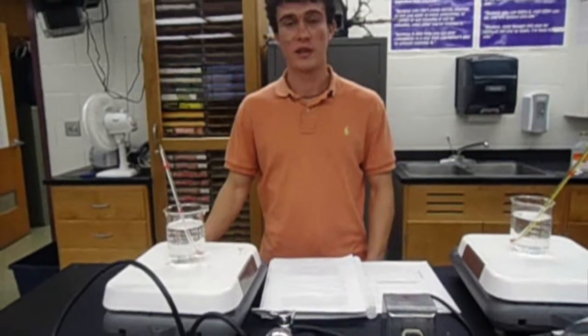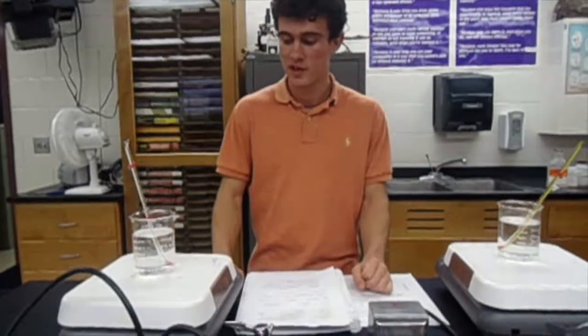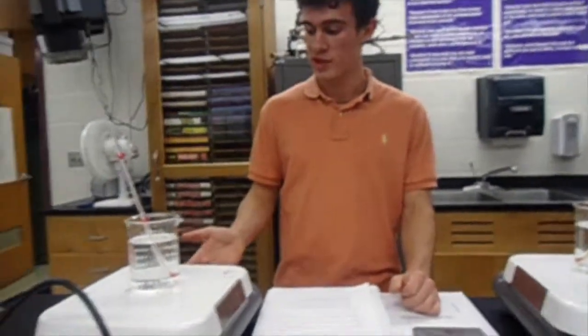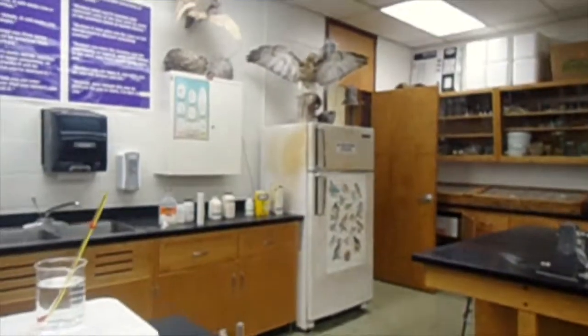I'm here doing a lab for my AP Biology class, and our discussion in class has been on cellular respiration. So we had to make up our own lab, which was pretty interesting actually, about cellular respiration and efficiency. We chose to do temperature, so we have ranging temperatures. Over here we have hot, warm, room temperature, and cold. We're going to see how cellular respiration is in those different temperatures.